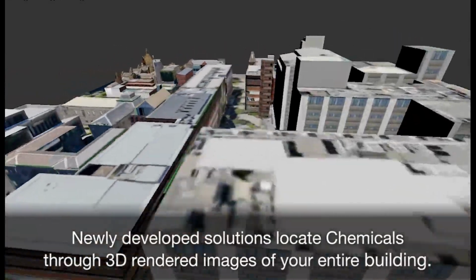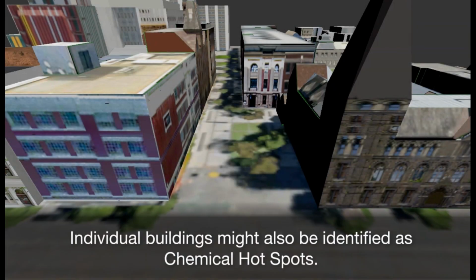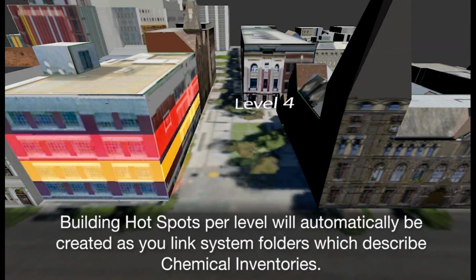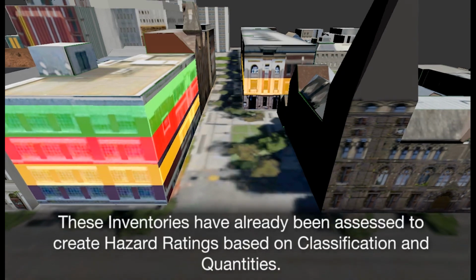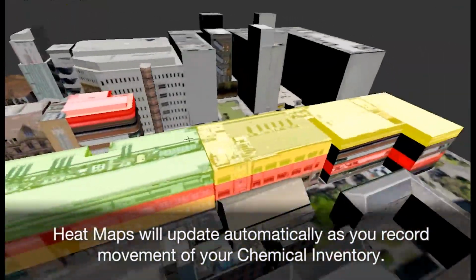Newly developed solutions locate chemicals through 3D rendered images of your entire building. Individual buildings may also be identified as chemical hotspots. Building hotspots per level will automatically be created as you link system folders which describe chemical inventories. These inventories have already been assessed to create hazard ratings based on classification and quantities. Heat maps will update automatically as you record movement of your chemical inventory.